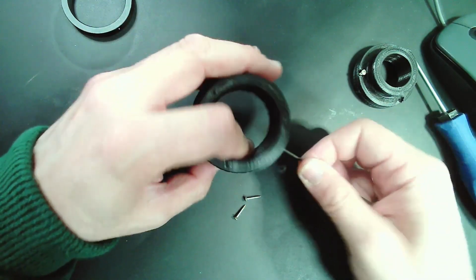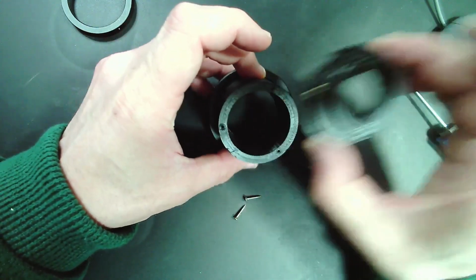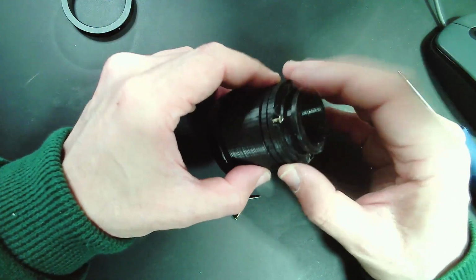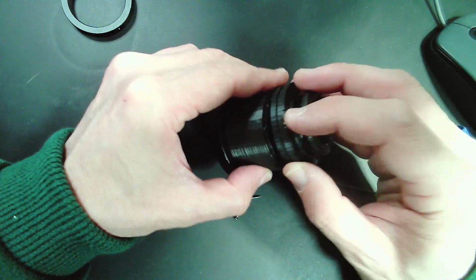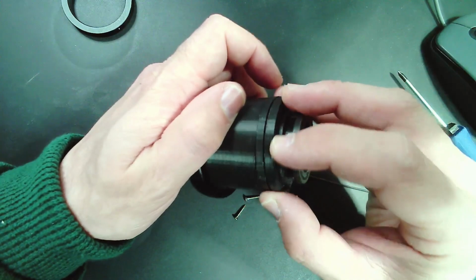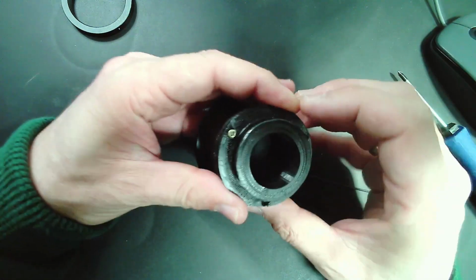So here again, and on the other side, I have to, of course, connect the part here. I'm not going to show this to you now because this does take time and I have a problem finding the holes again. Here it is. Yeah, maybe this is correct. Yeah. Here we go.